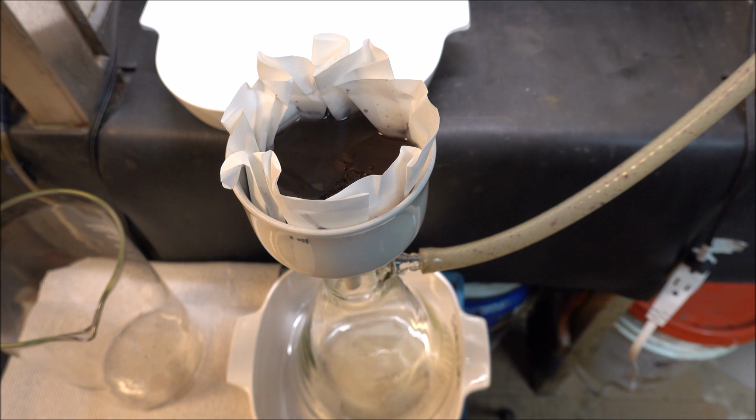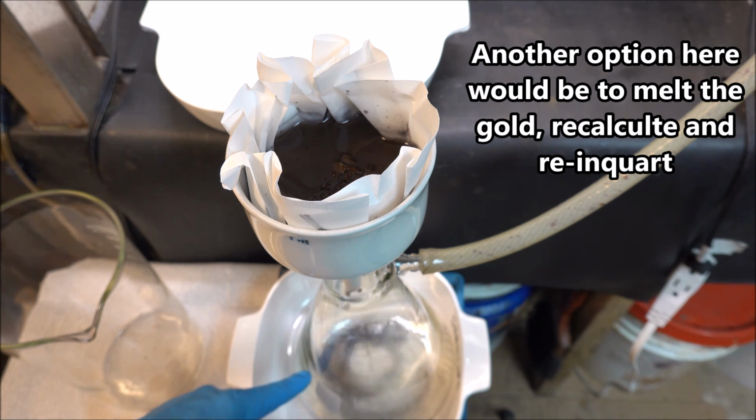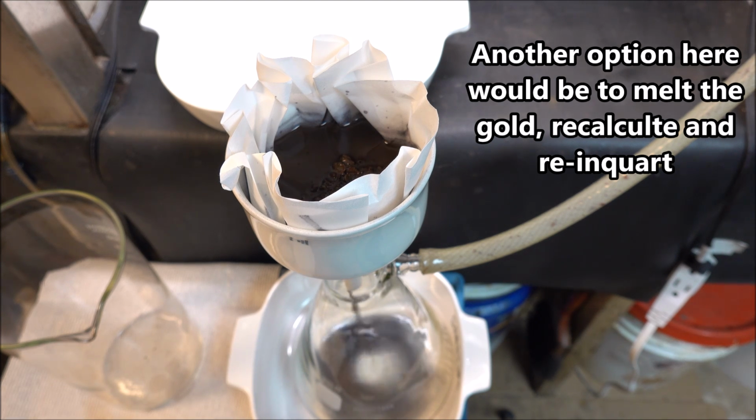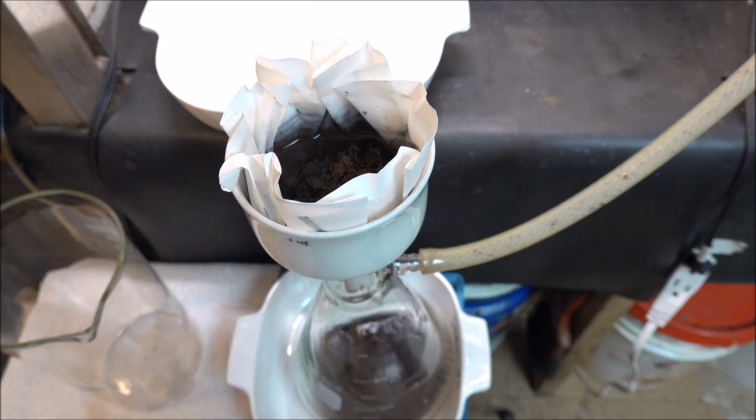All right, now I'm going to light off the vacuum pump, start pulling that solution out of the gold. As you can see, I've got a little bit of color coming through. It's got just a little bit of a purple tint to it, which tells me this is colloidal gold. Gold that's so fine that it passes right through a filter paper. Another problem with adding too much silver for the inquartation.